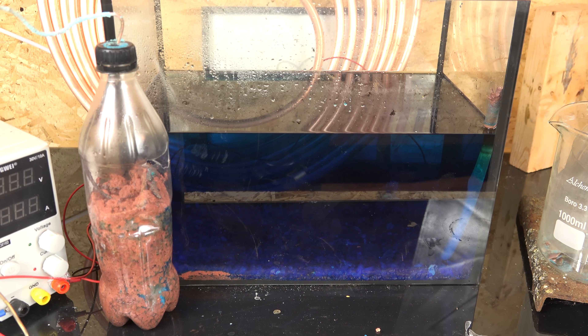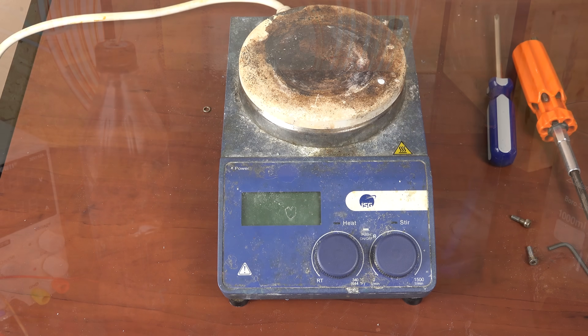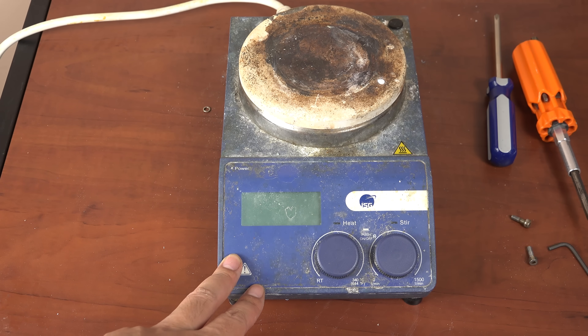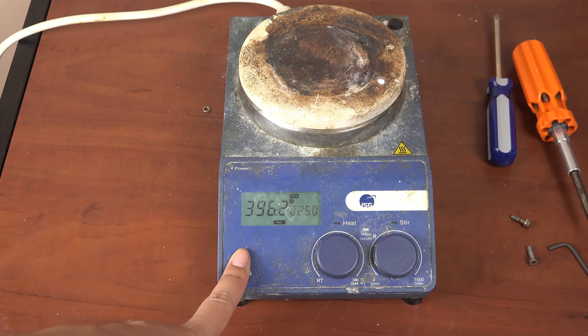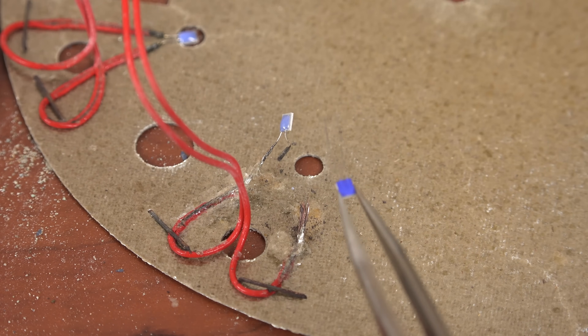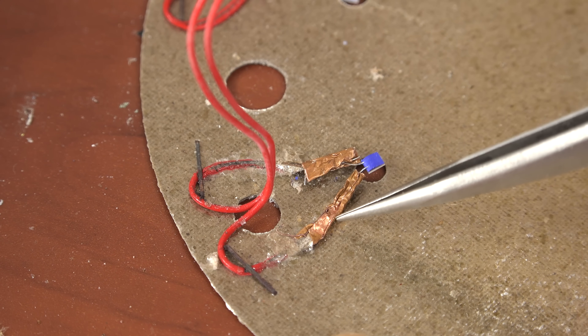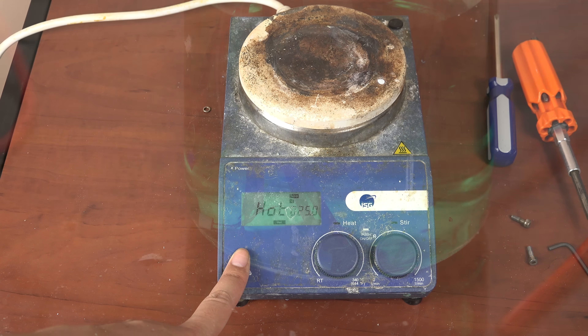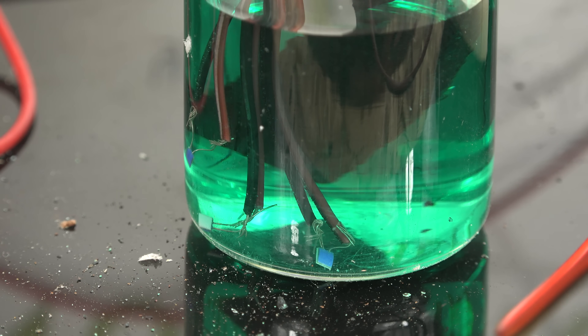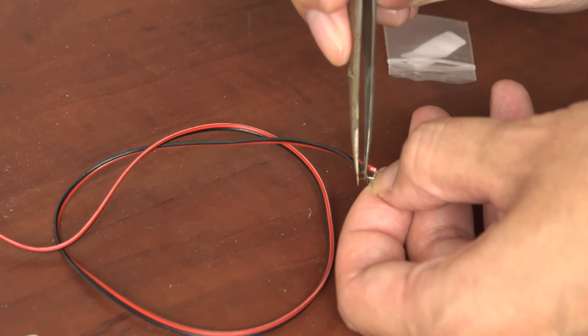That was my quick and crude way of making copper sulfate. It's not worth it in terms of labor, but for some reason I couldn't get actual copper sulfate — must be a worldwide shortage or something. Moving on, I also did some lab equipment repairs. Way back, my hotplate stirrer suffered a malfunction — the temperature sensor inside had broken. Finding a replacement was easy but connecting the wires was hard since I couldn't use solder; at hotplate temperatures the solder would melt. I tried copper tape and while it worked, it didn't last long. It recently failed again, so this time I'm going to bond the sensors to the wire using electrochemistry.